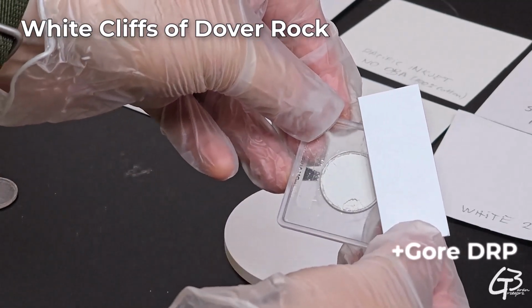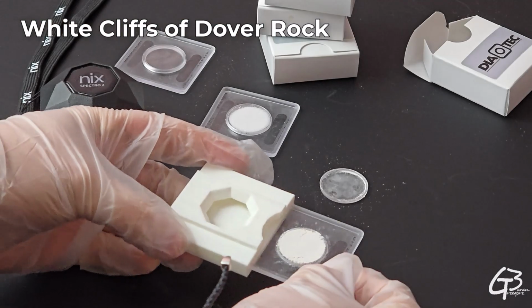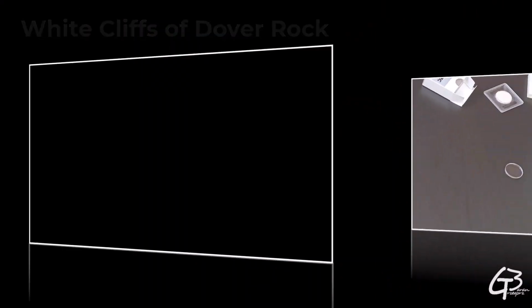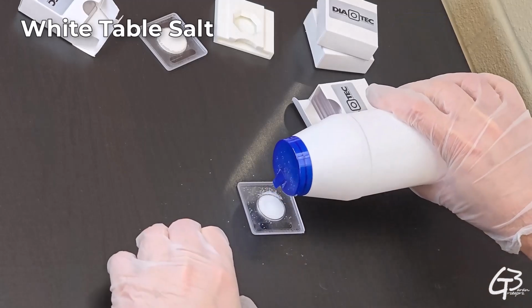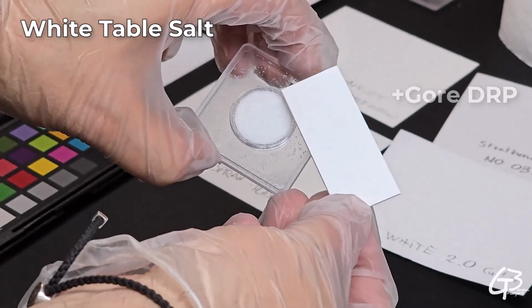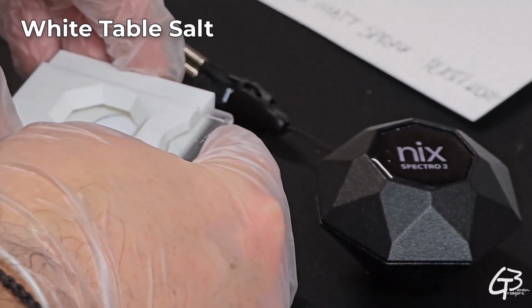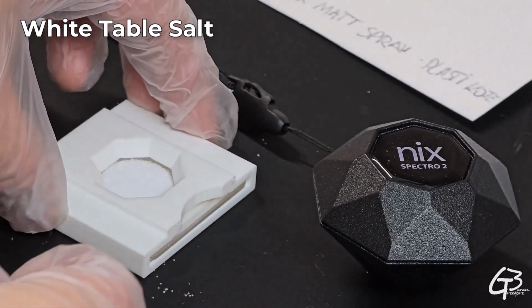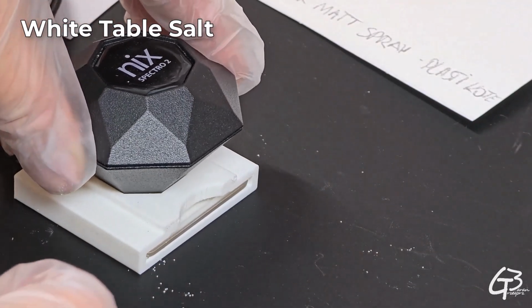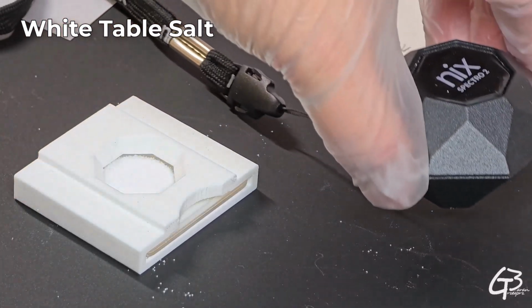Since semi-solids, liquids and powders are typically challenging to measure accurately, I also used a special dedicated slide to prepare the sample and measure it with a special chamber adapter. I have heard that some folks use salt as a white reference for white balance setting to save on white balance cards or color checker, and since it definitely falls into the category of common white looking substances, I decided to include salt in this comparison too. Since such a substance can be very tricky to measure properly, I also used a dedicated measurement slide, so it can be measured with a special chamber adapter too.